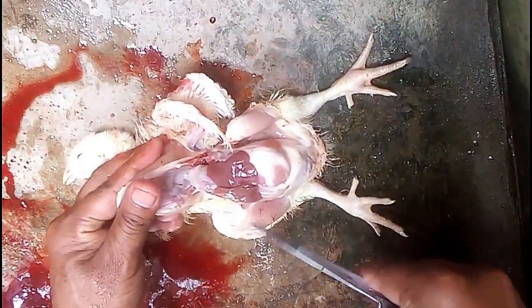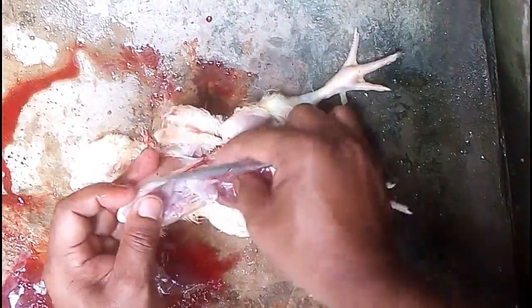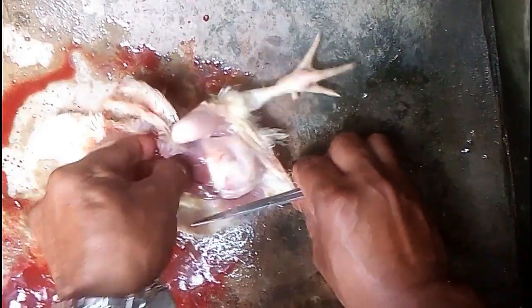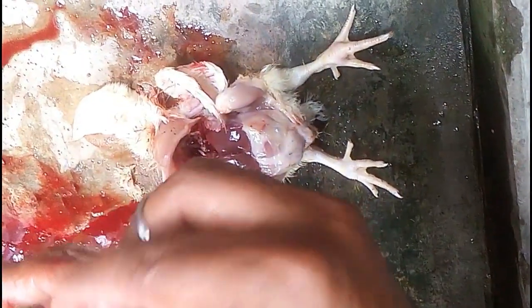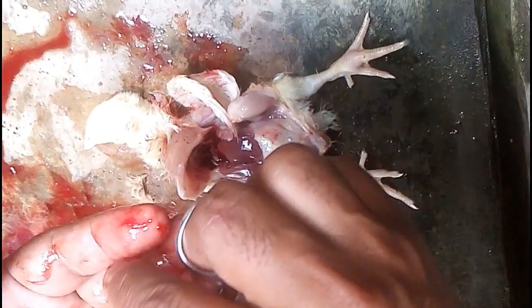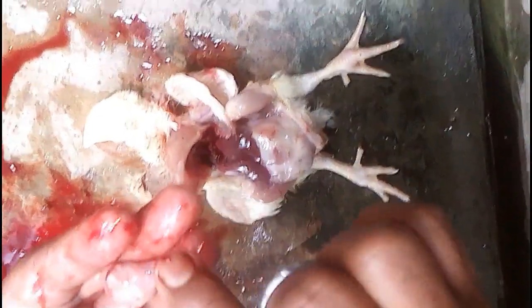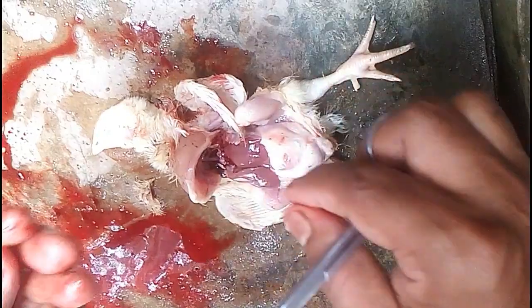Here we see the liver, heart, and gizzard. We found that in the heart there is a caseous mark — it is the extra covering of the heart caused by E. coli infection. We try to separate this caseous mark, but it is slippery.